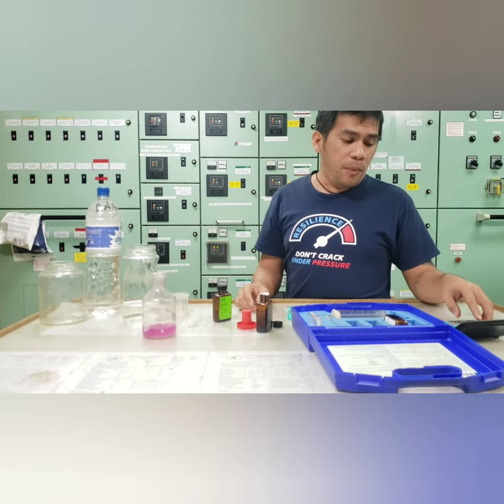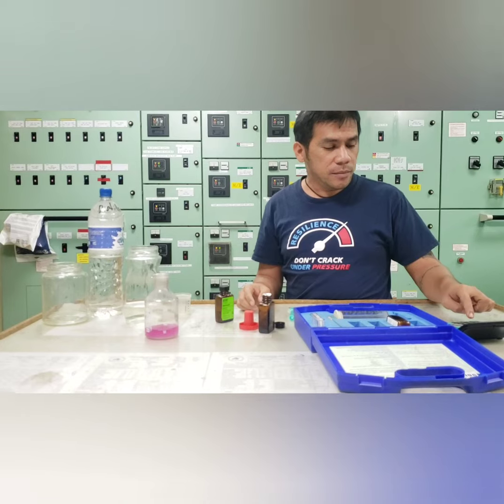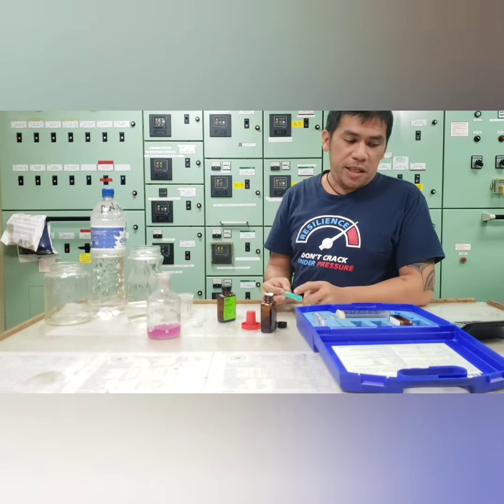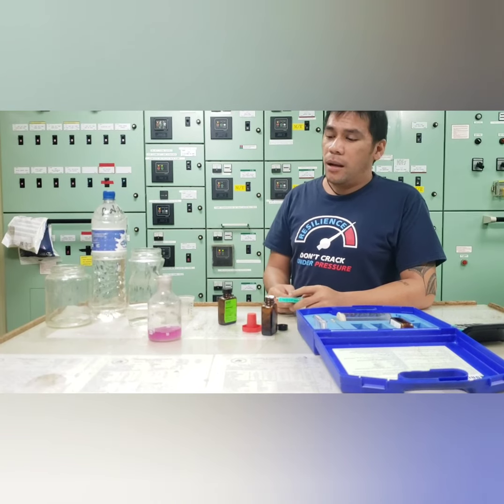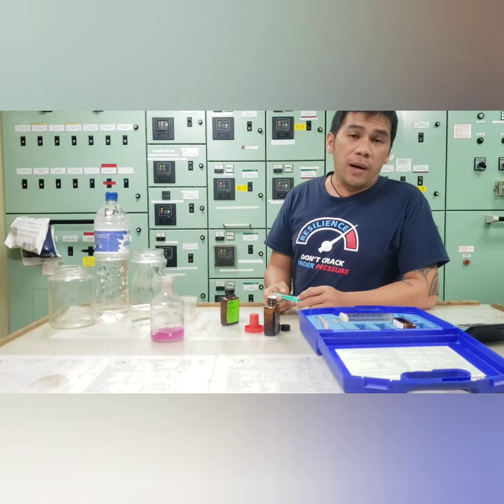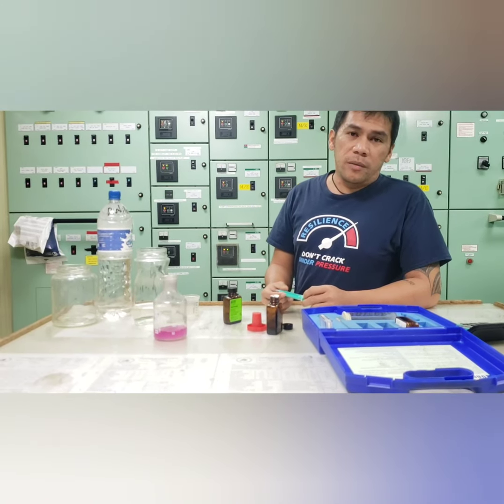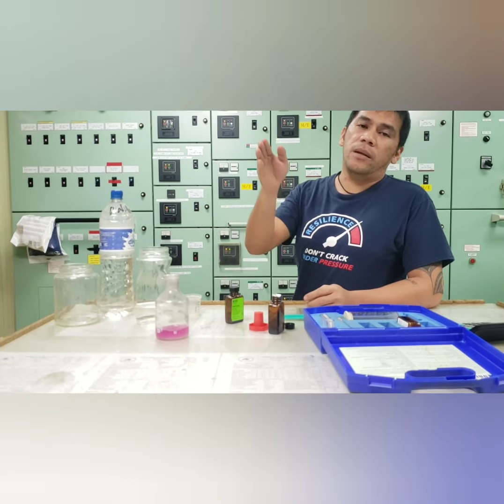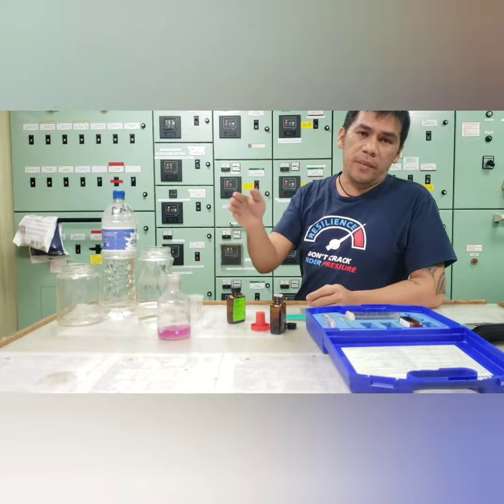So it will come up with 1,260. So the normal range of your cooling water system, the nitrite, is 1,000 to 2,500 or more. So better, you will going to have in range between 1,000 to 2,500.